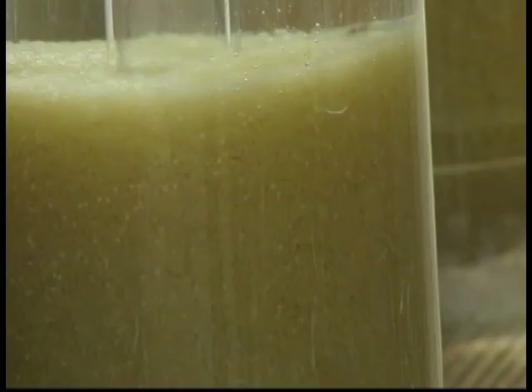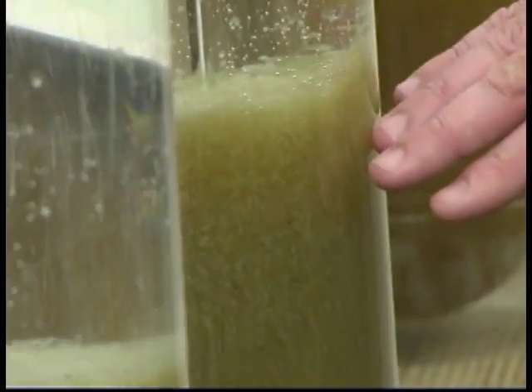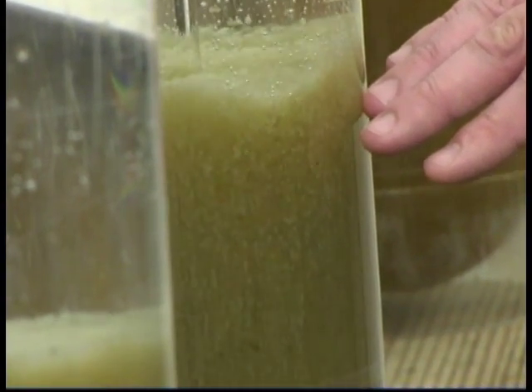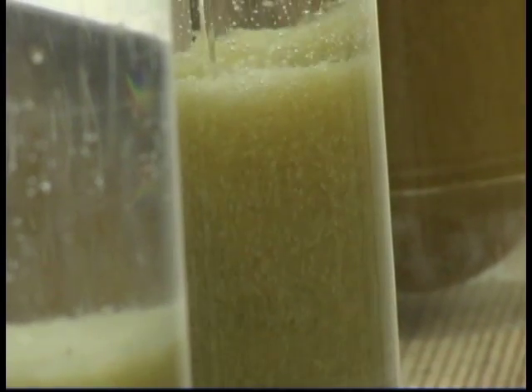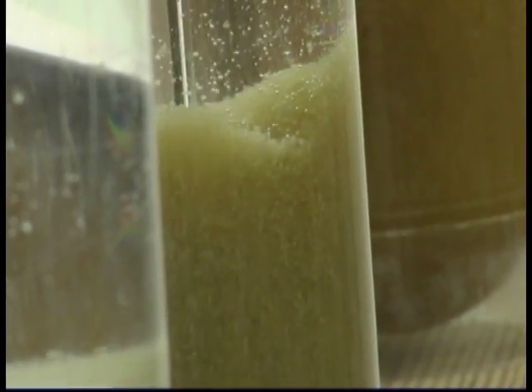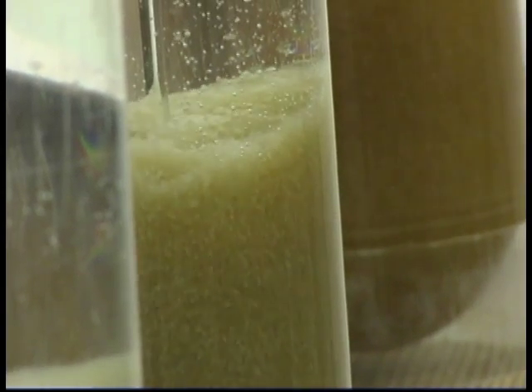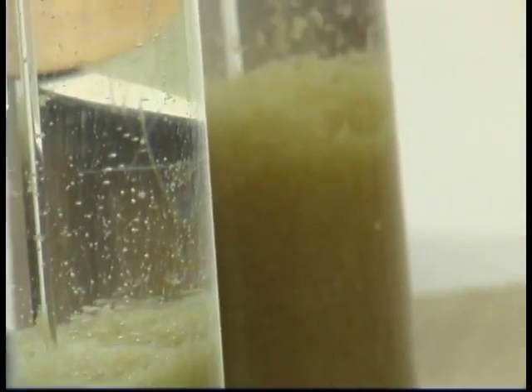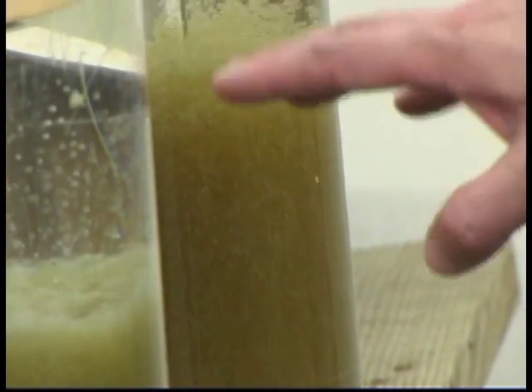Here you can see more white eggs. At that stage, all unfertilized eggs are already white. So, it's a big difference from yesterday. Visually, without a microscope, all of the eggs were transparent yesterday. But now, the unfertilized eggs are already white.